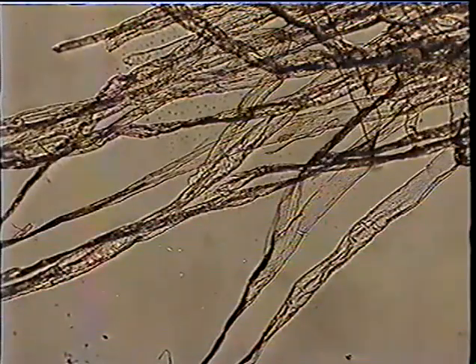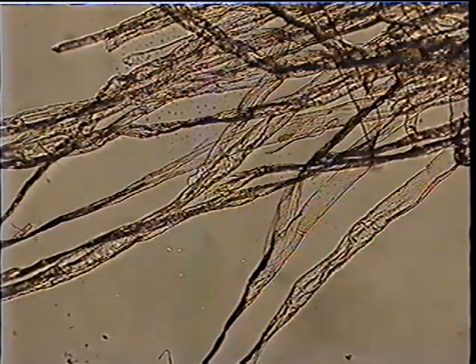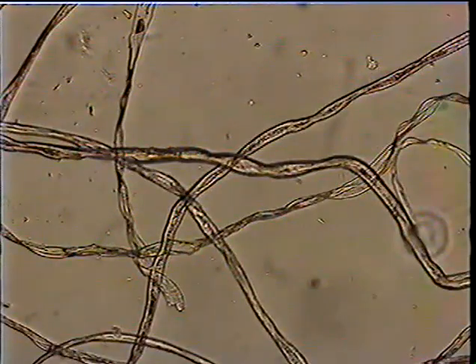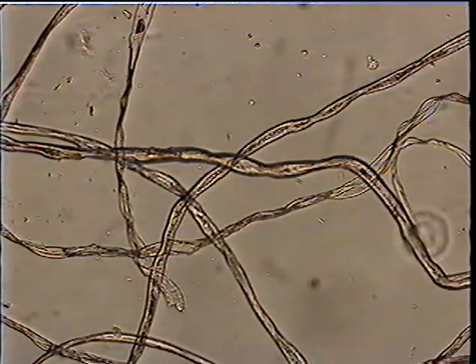These are fibers. They're paper fibers from a tree, wood fibers, softwood fibers. Recognizable as such by a microscopist. They're little flat ribbons. They have little pits through the walls of the ribbon, which we don't see here very well. These are also cellulose, like the wood fibers. These are cotton fibers. They're not ribbons. They're twisted. And the twists are what tell us that this has to be cotton.